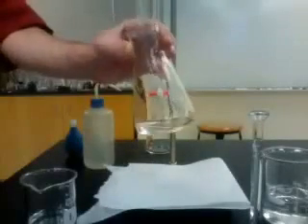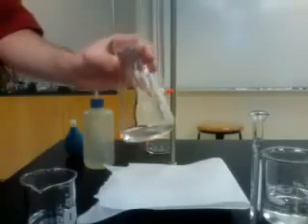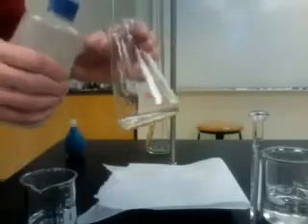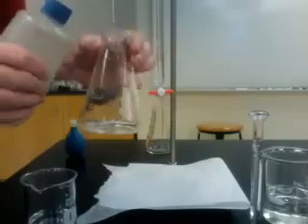EDTA is a simple chelator that can be used in the analysis of many metals. In this case, we're doing an analysis of calcium. The calcium sample is aliquoted into a flask and rinsed down with DI water.